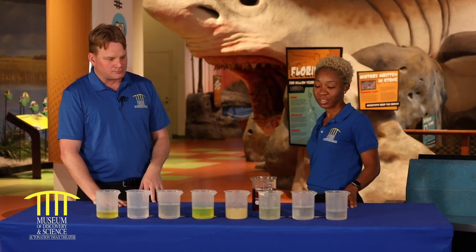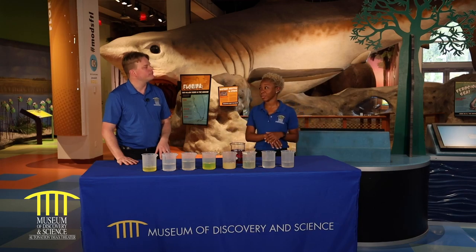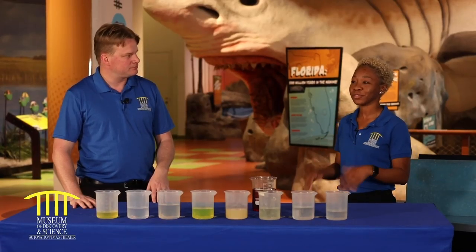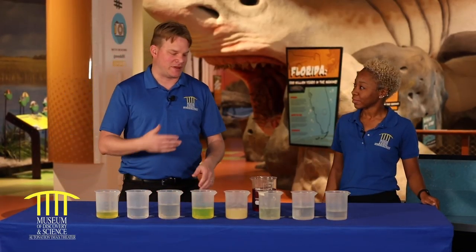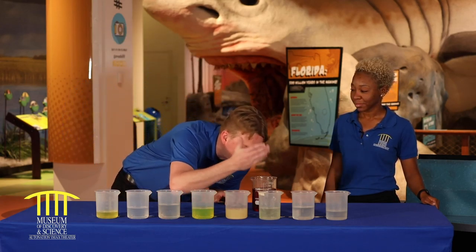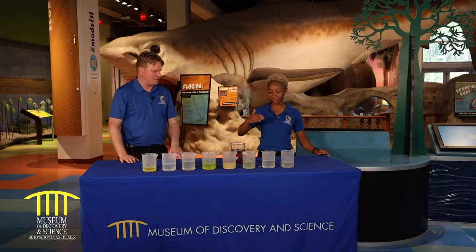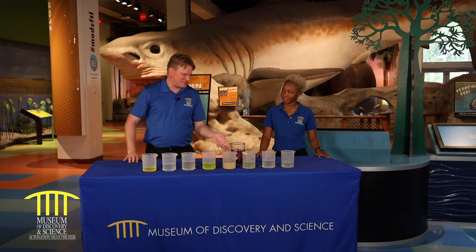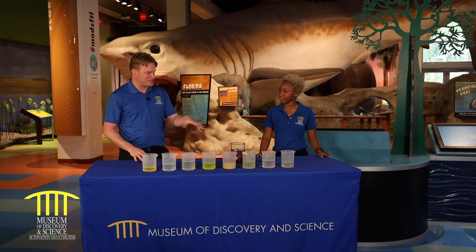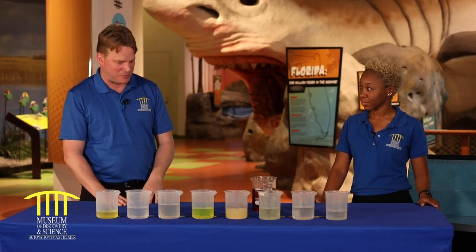You can use things like an indicator to test whether things are acids, bases, or different chemicals. We have this thing called phenol red, which we'll be using today. Somebody also explained to me the waft method — to get a smell off of something, you waft it. But there's definitely no smell here, so this indicator is going to indicate something else.